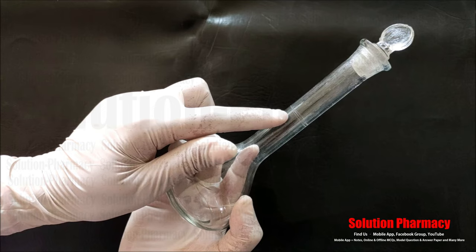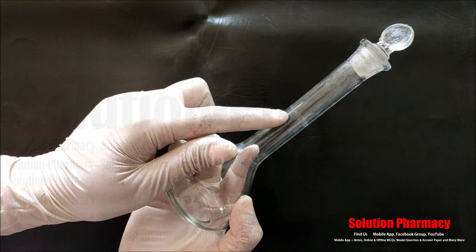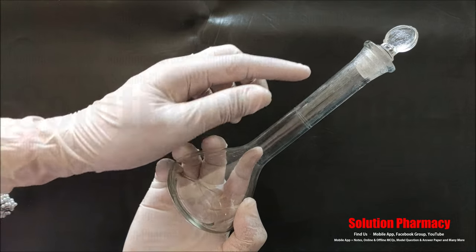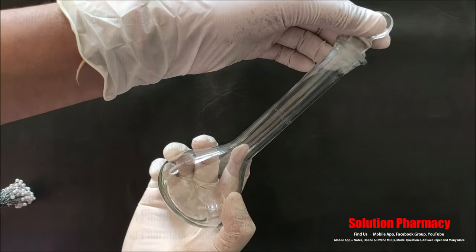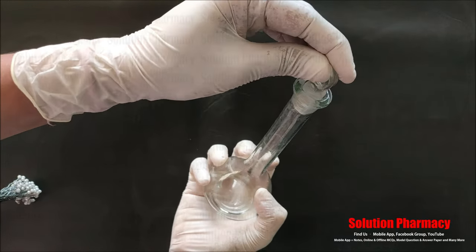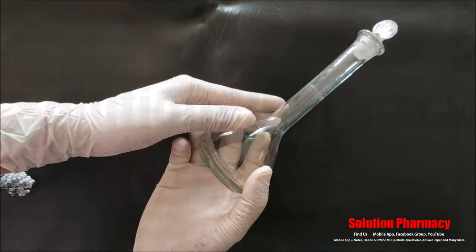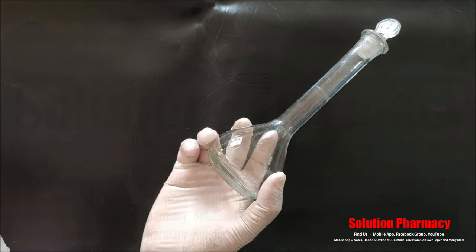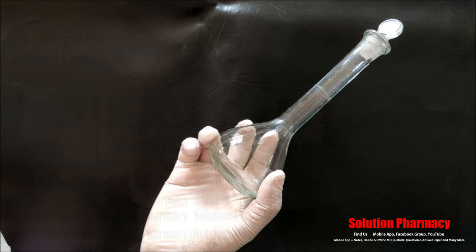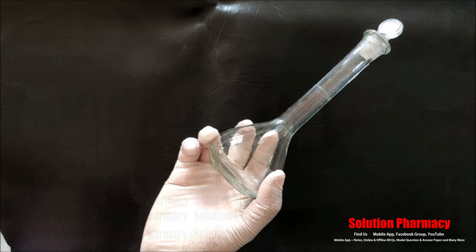Different volumes of volumetric flask are available, like 10 ml, 250 ml, and 500 ml. We fill up to the mark to prepare that specific volume of solution and add a stopper. This volumetric flask is used for volumetric analysis and is more precise and accurate compared to the beaker, conical flask, and measuring cylinder. We use it to make stock solutions of specific concentration.